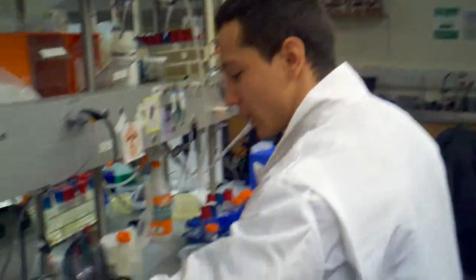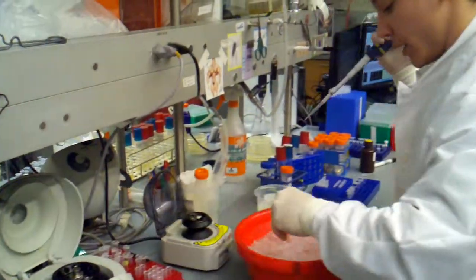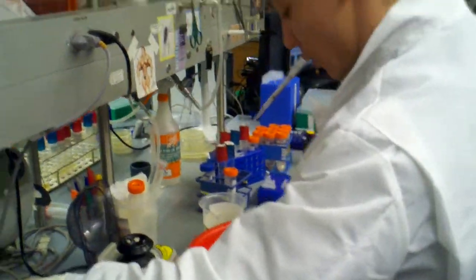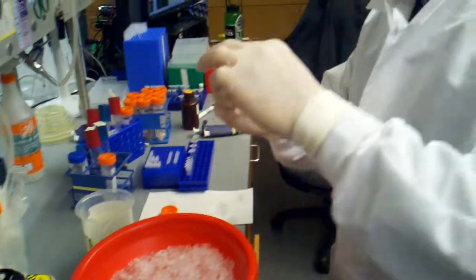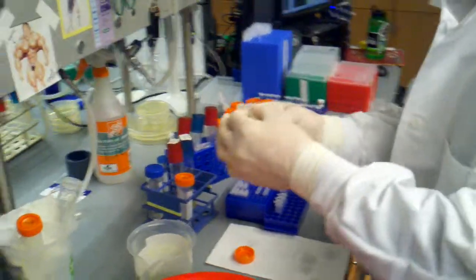We've just finished our spin down. We're going to pull these off and immediately back onto ice. We need to keep them cold. And we're going to pour off all that excess glycerol. So you can see we get a nice pellet, tons of cells. We're going to pour it off.